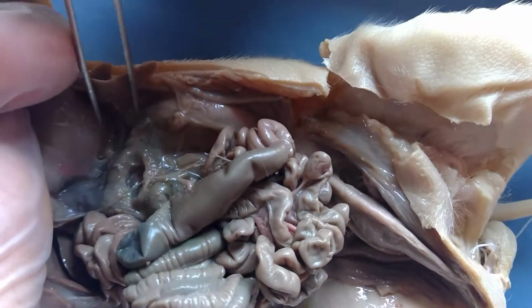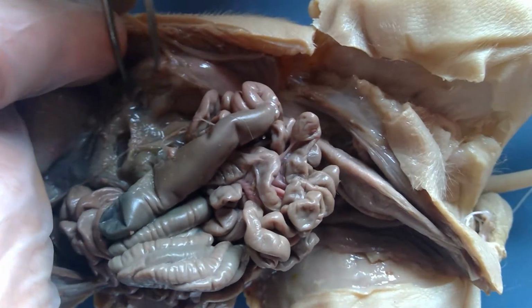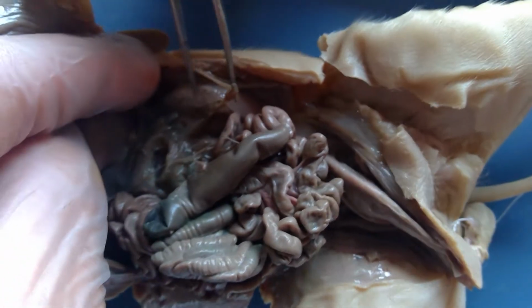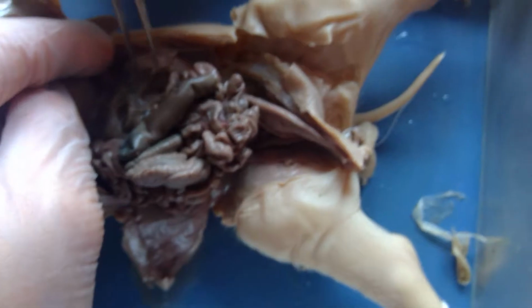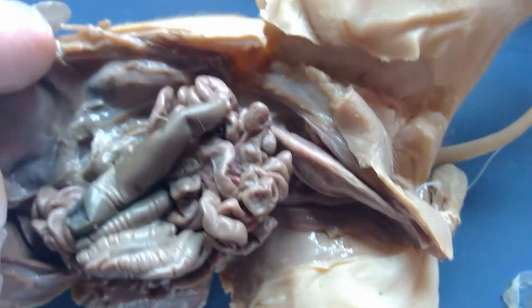Okay, do you get enough light? Okay, peel away a little bit more. And you can see, all right, we need to pull your head away a little bit. Okay. Thank you, Gabe. Okay. You're going to need a blow.